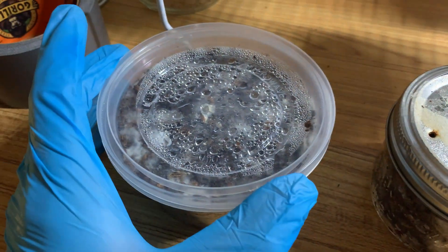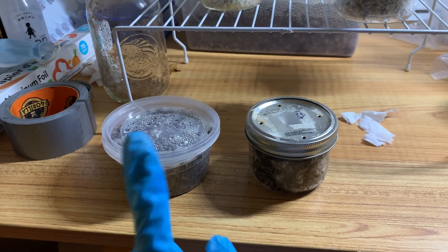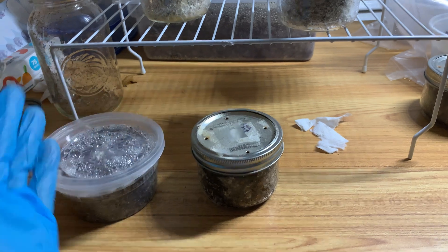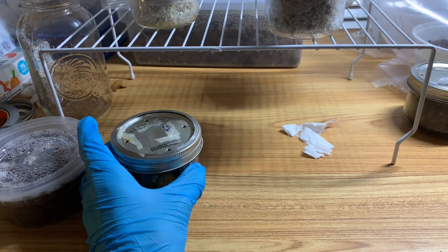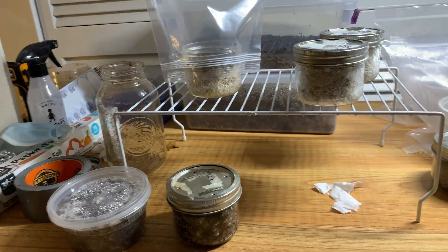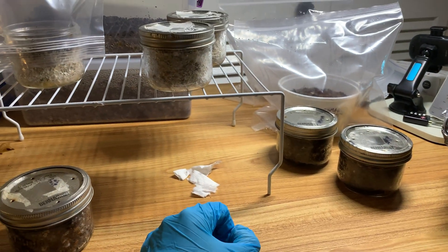So I'm going to pressure cook it. I've never had trich show up this early in my regular pasteurization ones. This leads me to believe that, just as I expected, sterilization is far more riskier than pasteurization. I foresee the others to also completely get trich as well.